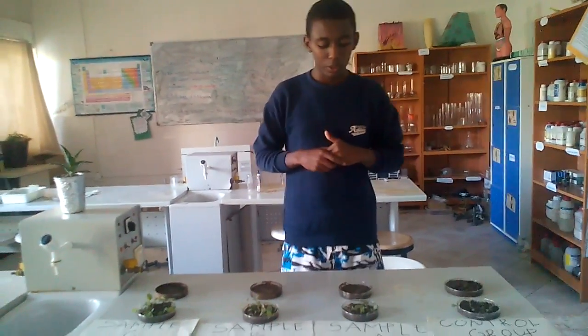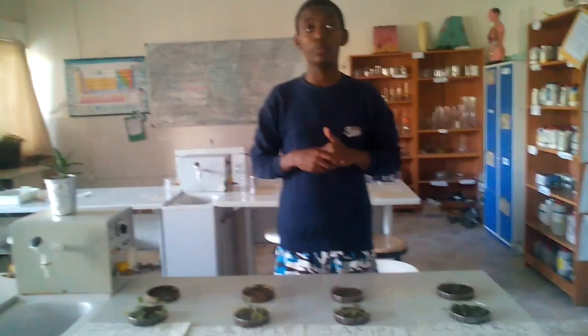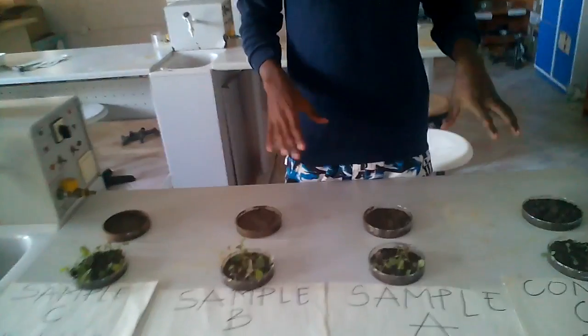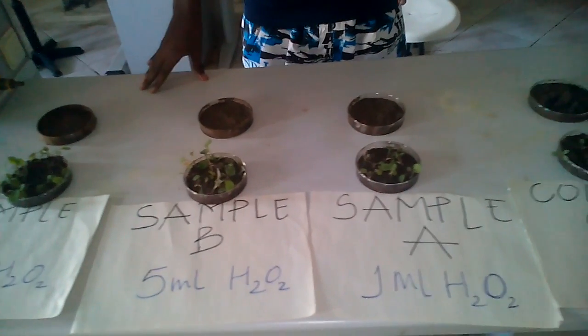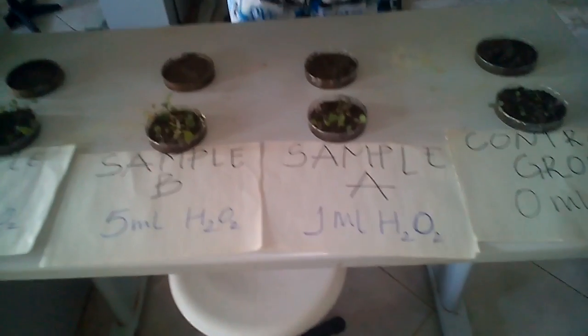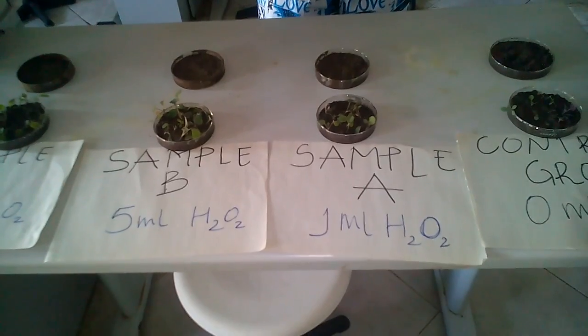Barakat, and this is a video session of an experiment made to analyze the effect of hydrogen peroxide in seed germination. As you can see here, I have 8 samples. The first 4 conducted as a first experiment and the second 4 conducted as my second experiment. So the objective of my experiment was to find out the effect of hydrogen peroxide in seed germination.